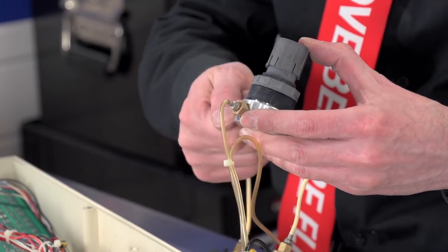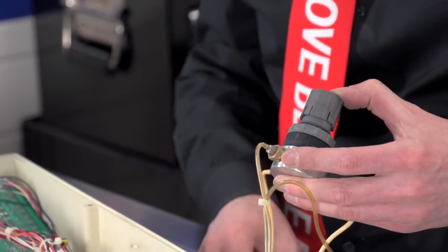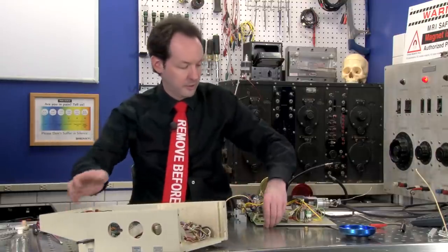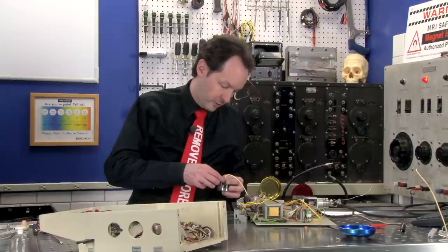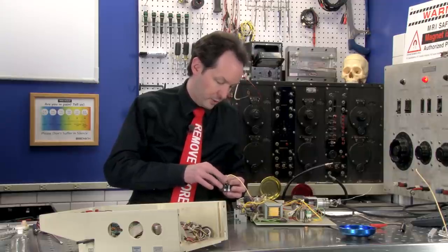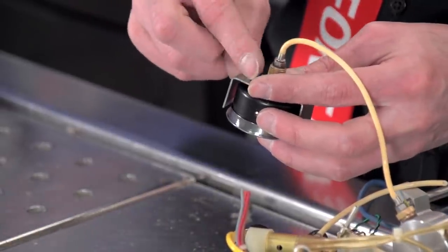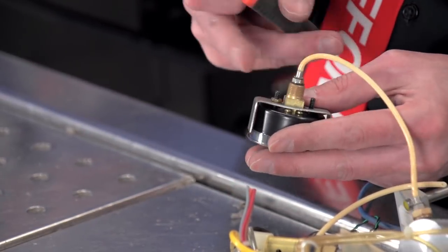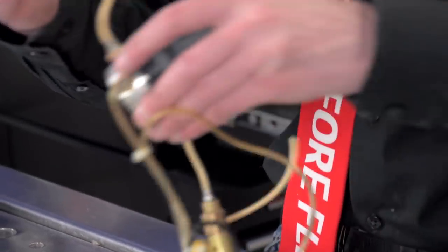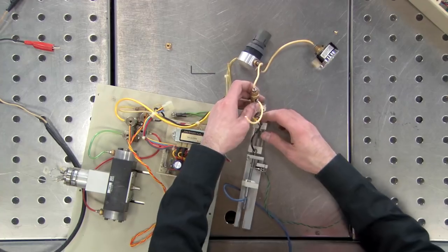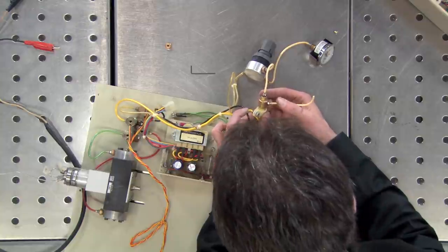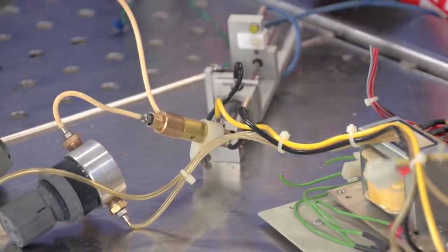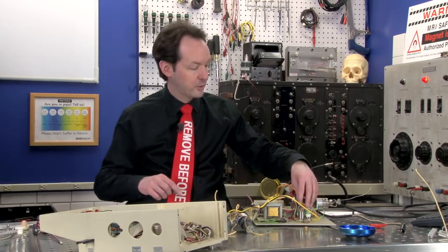Normally, I have one piece to get out. It's the pressure gauge. Normally, I don't take this much care to remove things intact, but on this particular project, I'm trying to, because they're some good pieces, and this is actually useful stuff. I just wish I knew how to undo these little crimp fittings they have on everything. Cool. Pop that out with its mount. Put that back together. And I can screw this back into the pressure regulator.